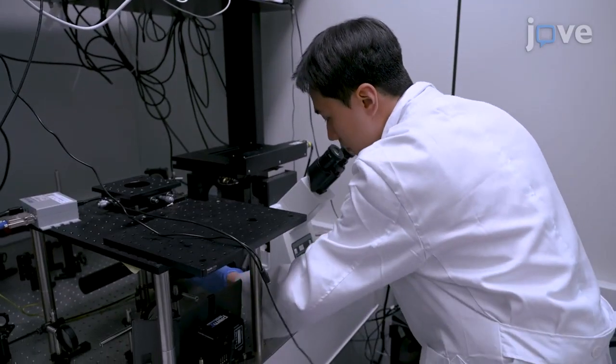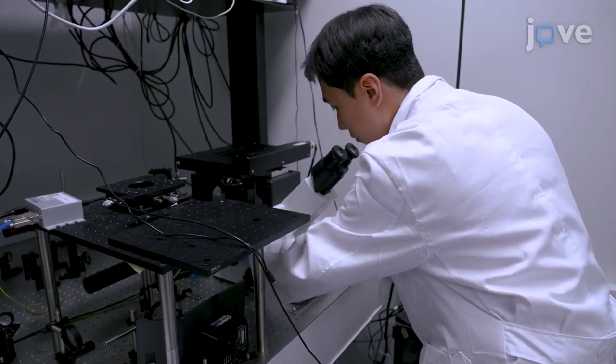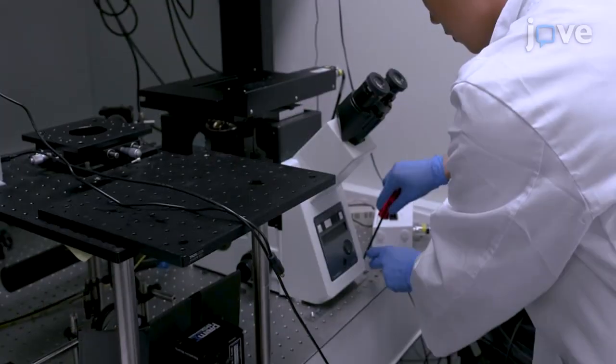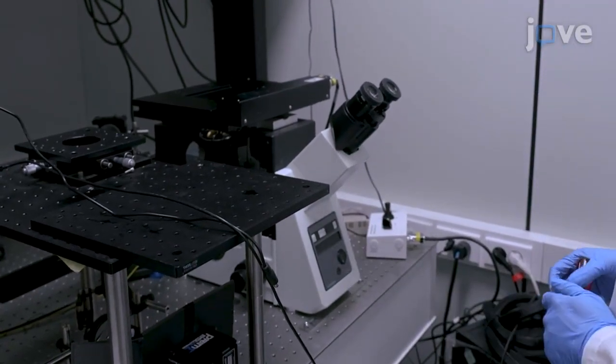Begin by setting up an inverted microscope on an anti-vibration optical table. Next, install a high-speed CMOS camera and a frame grabber.